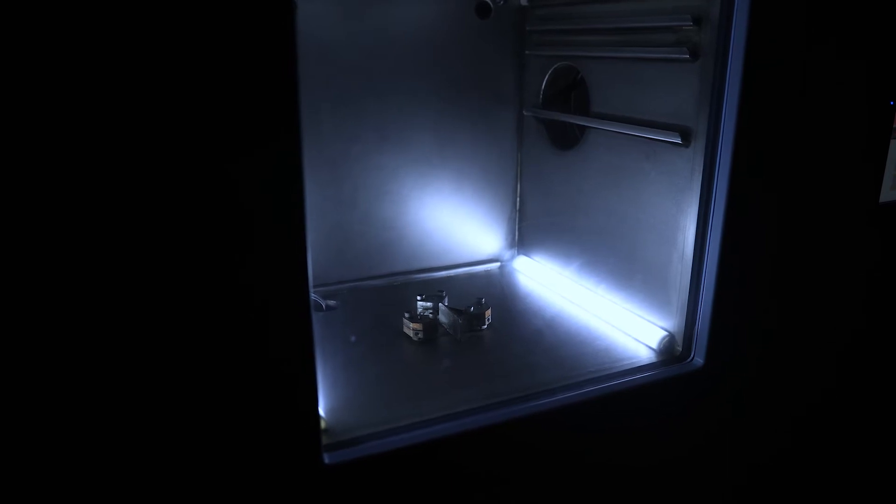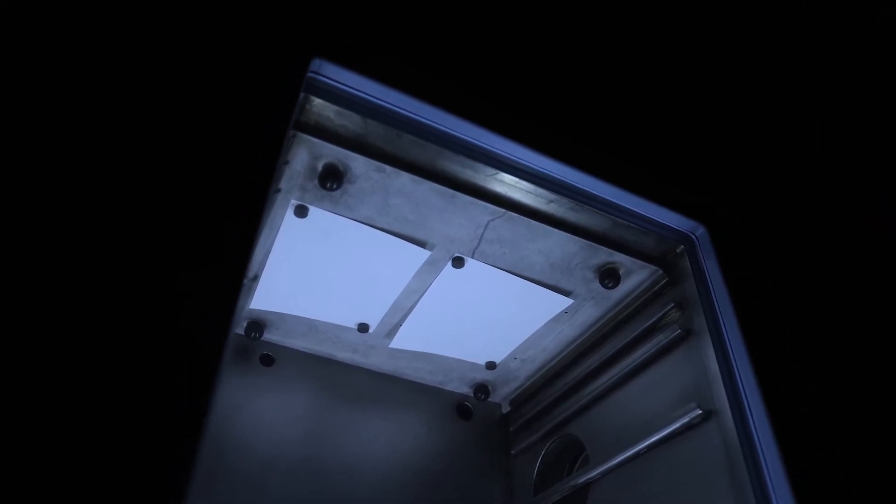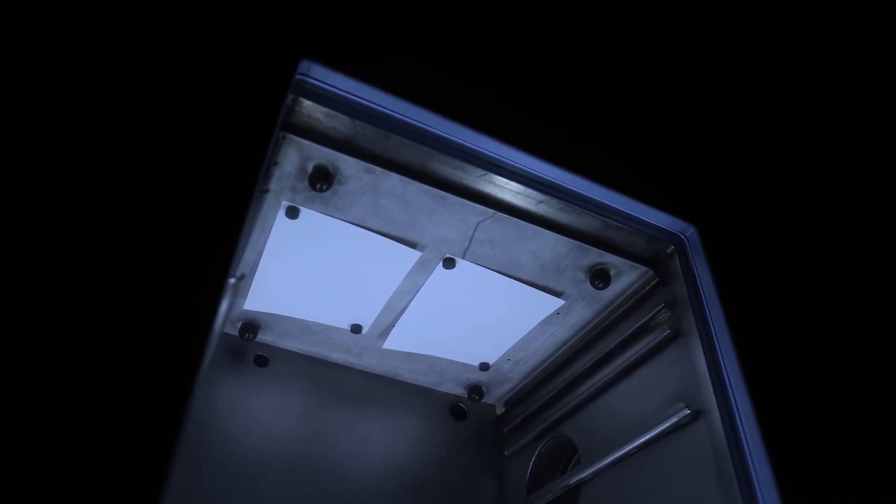The gold is burnt off, and we've got metal two — this is going to be your zinc. Now we're going to watch the card. The boat is heated, so we're going to get the vaporization of the zinc, which is going to turn the card gray. Once it starts, it's a real quick reaction, so I have to gauge it by the knob here. As you can see, the development is taking place at this point. I'm going to turn the zinc off.